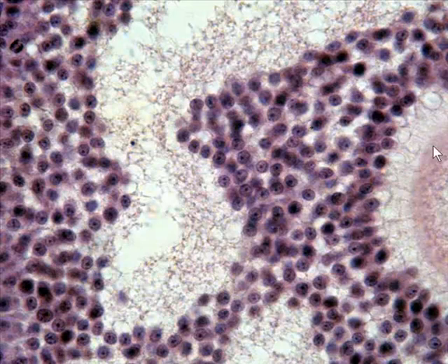This just shows a good zoom up of, again, a secondary follicle with our oocyte here. Here's that pinkish zona pellucida we were talking about, the corona radiata, which is going to be this first layer of cells through here, and then the cumulus oophorus, which is the cloud of cells, which are basically, like we said, granulosal or thecal cells.